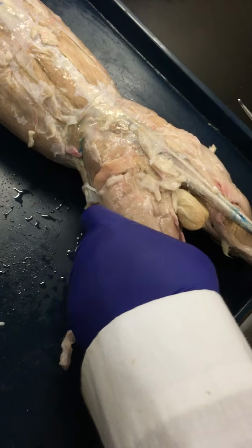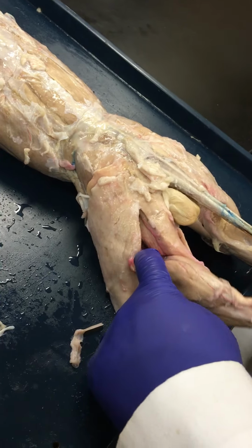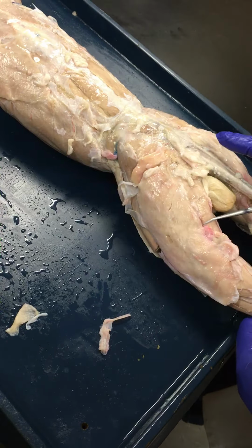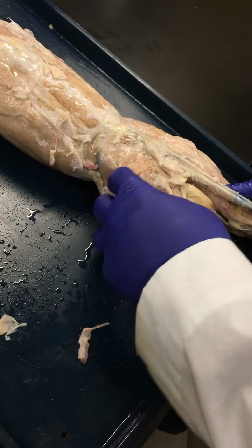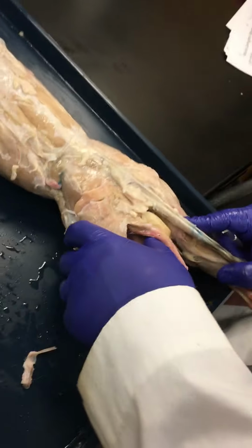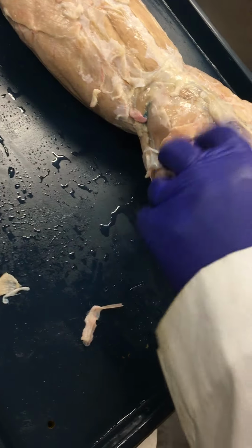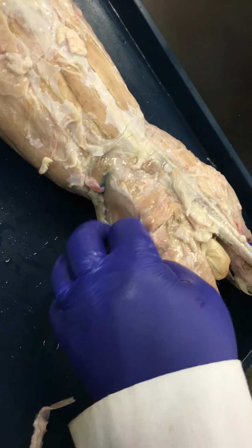So the action of the hamstring group, one of the main actions I want you to consider is flexion of the knee. But when you consider the biceps femoris, this plays a role also in abducting the thigh. So think about the biceps femoris for that as well. But otherwise, flexing the knee. And the last thing to consider for this one is extension of the thigh at the hip, and it's going to work in conjunction with the gluteus maximus to do that.